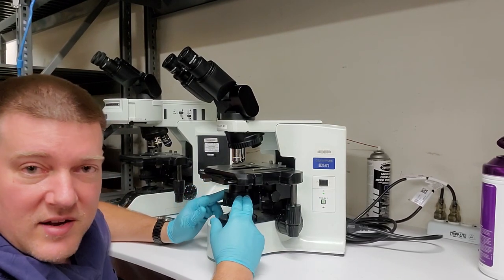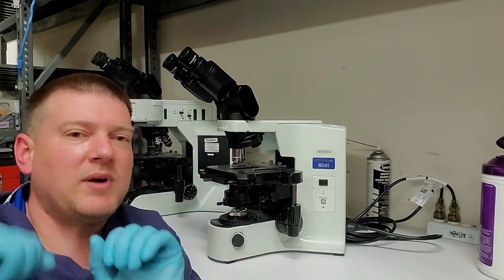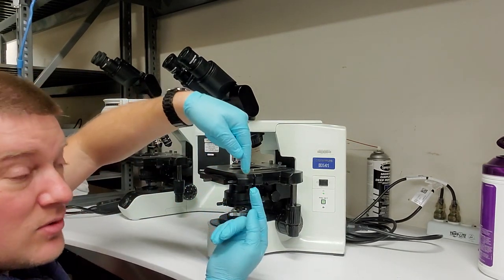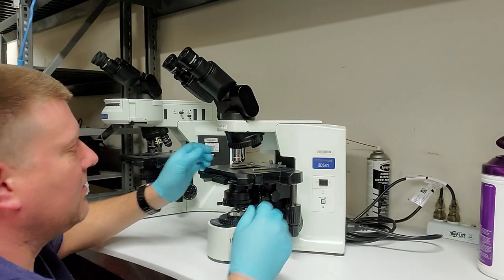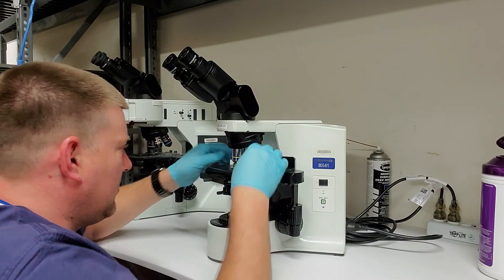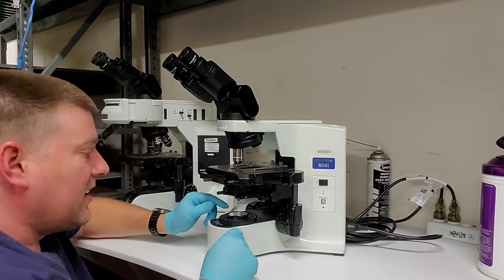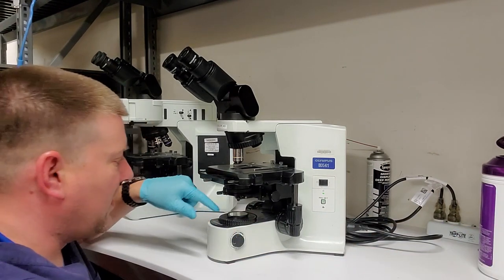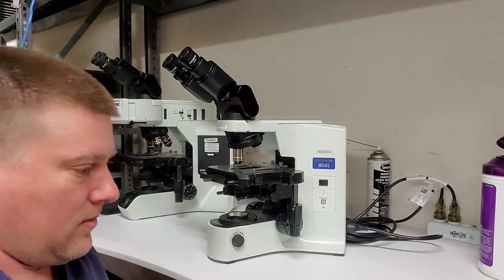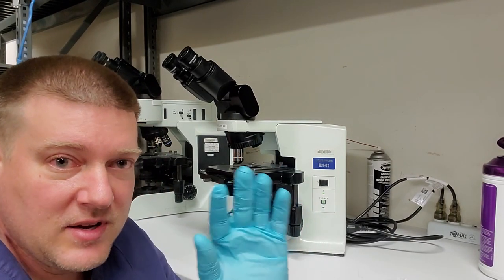So my condenser wasn't seated completely in its cradle. It was a little bit proud, so I had to reseat it. You want to make sure it's completely in there. That way, the two triangles that I was talking about line up perfectly. Okay, I'm going to raise it all the way up. Make sure that they're lined up. They look really good. The next thing that we're going to worry about is down here, we have that filter glass that I was talking about.